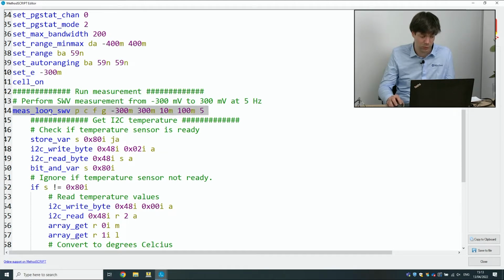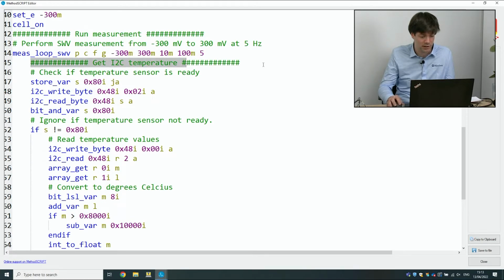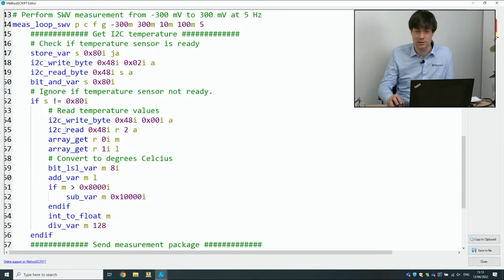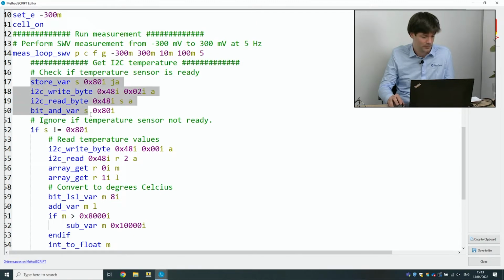So measurement loop SWV stands for measurement loop square wave voltammetry, and these are the parameters that we set in PSTrace. Here we've added an I2C temperature sensor. We're going to read out the temperature from an I2C sensor. This is just one of the things you can do. In MethodSCRIPT, we've exposed the I2C bus. So in theory, you can connect to any I2C peripheral and use that in your script. Temperature sensor is just a nice example that we are using right now.